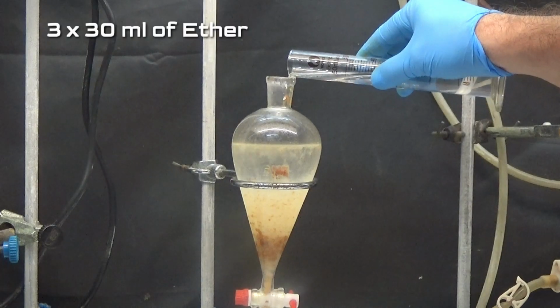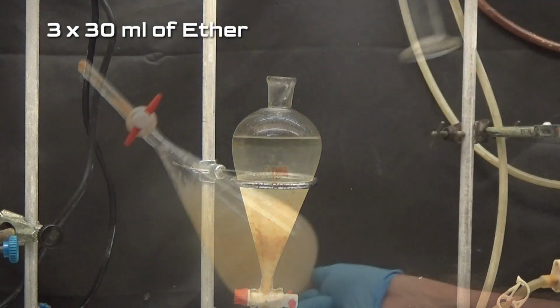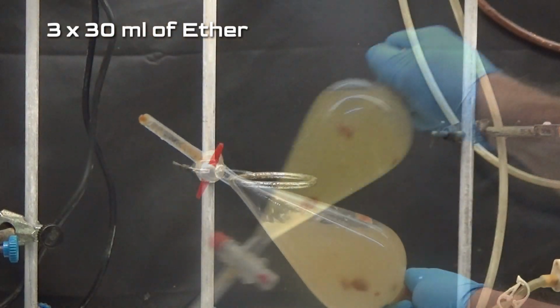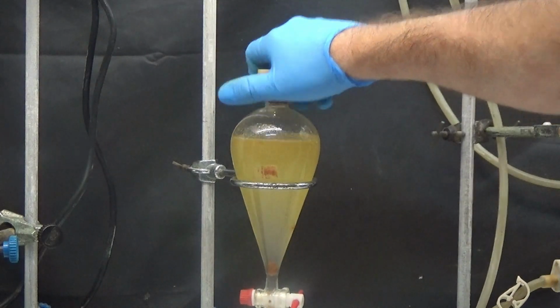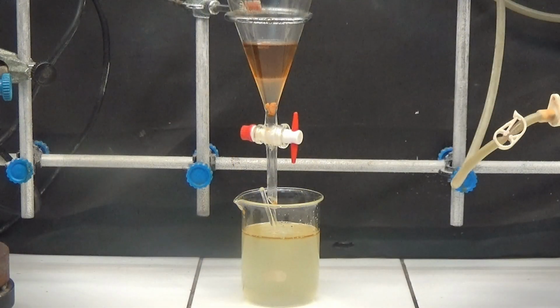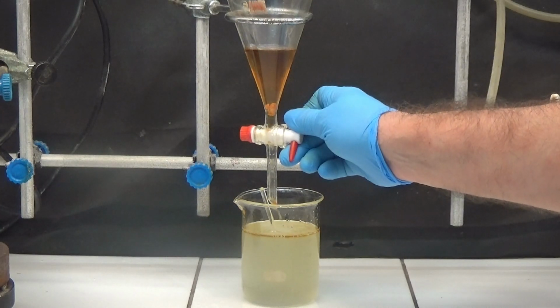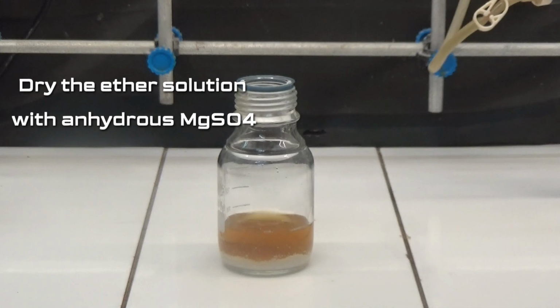Extract any oil that has not decanted 3 times with 30 milliliters of ether. Dry the ether solution with anhydrous magnesium sulfate.